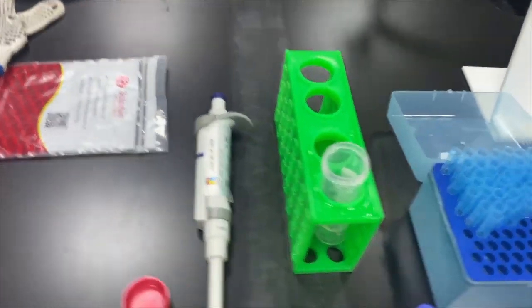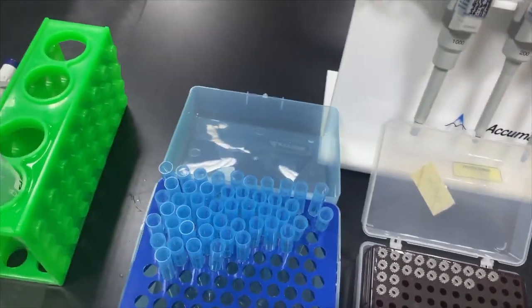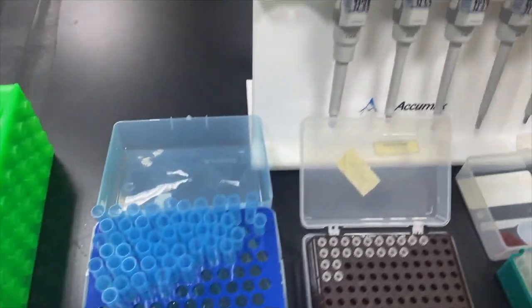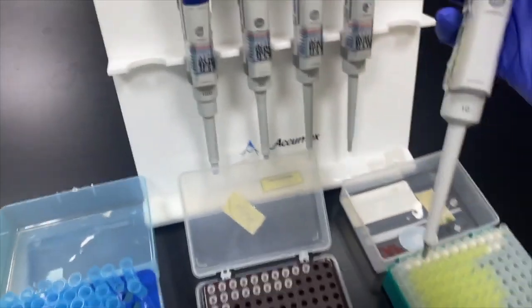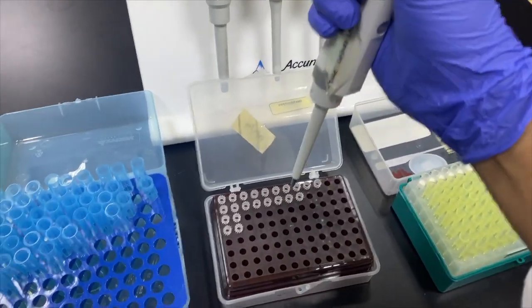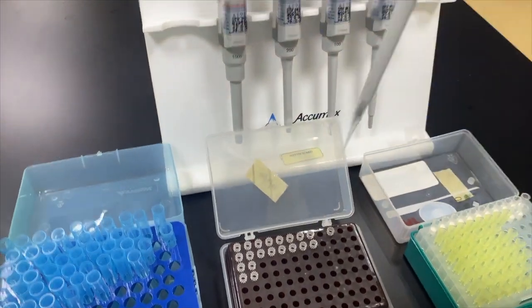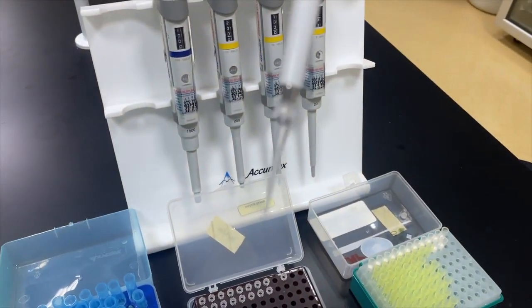And then you put the tip into the other container. So, there will be similar for the medium one. And now I will show you about the small one. Okay. This is how it looks like.